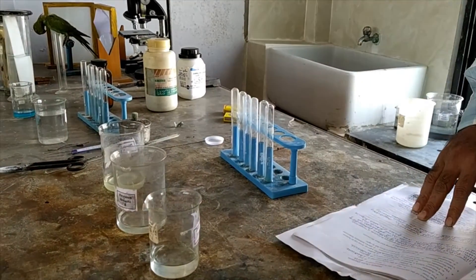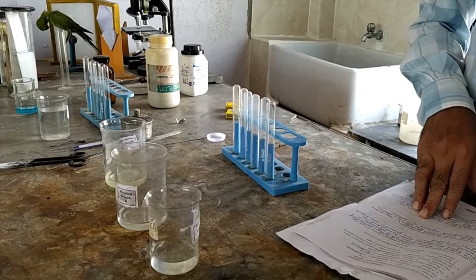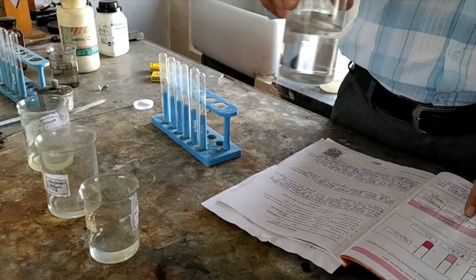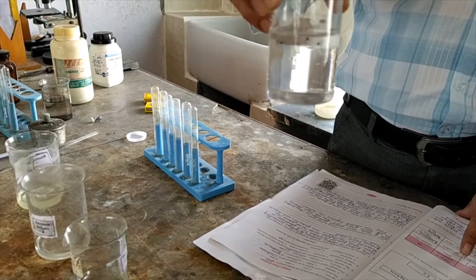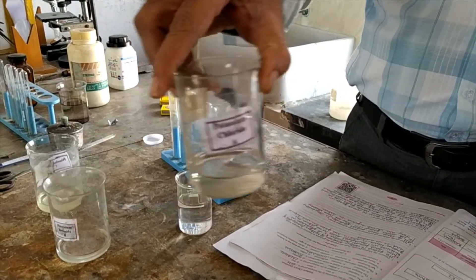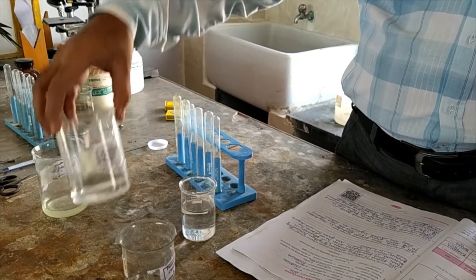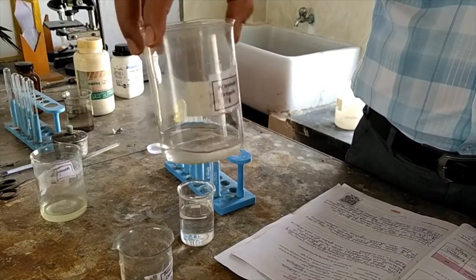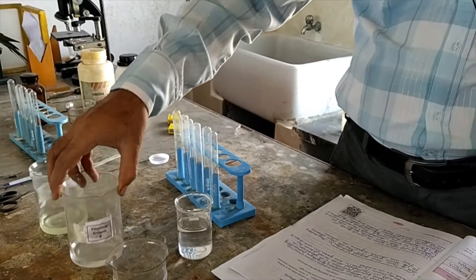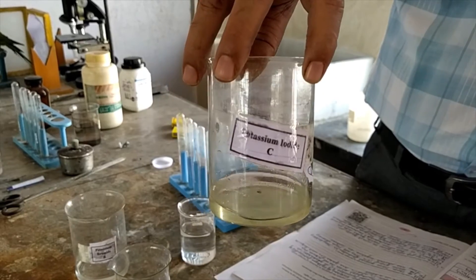The chemicals required are: first, silver nitrate — this is the silver nitrate solution. This is potassium chloride solution, this is potassium bromide solution, and this is potassium iodide solution.